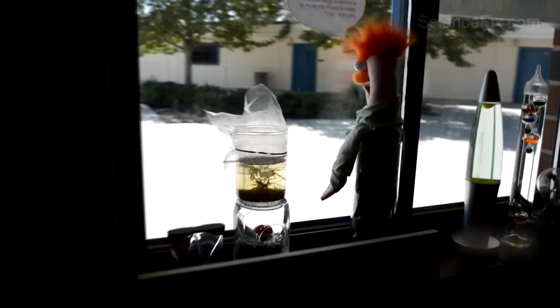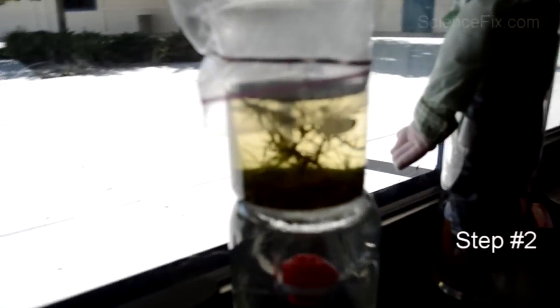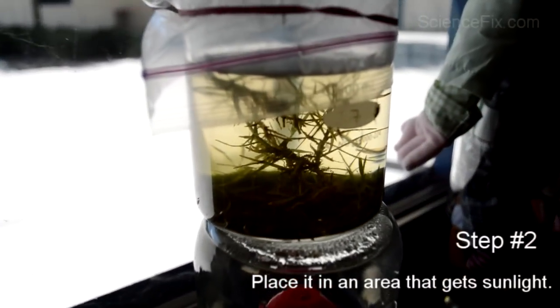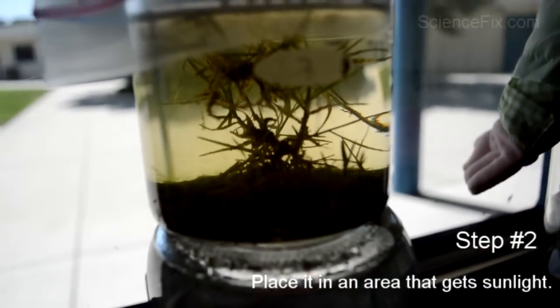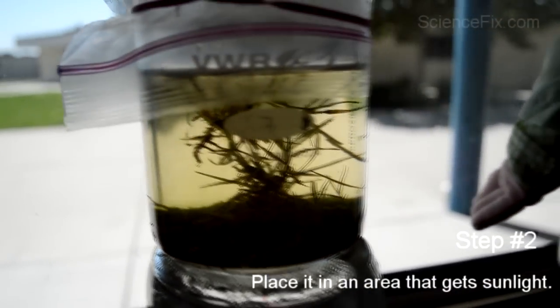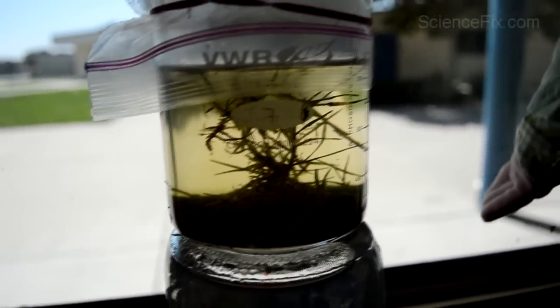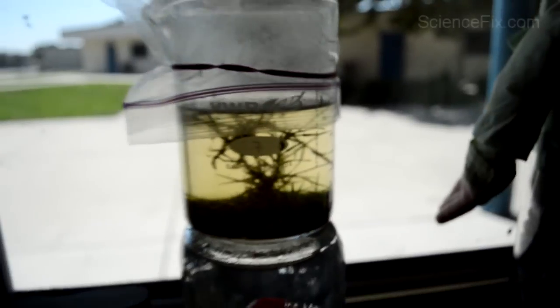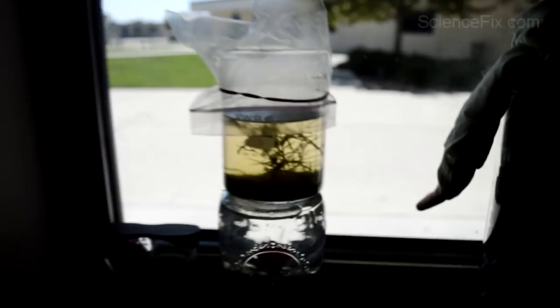You're going to want to put some kind of plastic bag that covers the beaker so that all the water doesn't evaporate out of it. Then put the beaker in a windowsill so it gets plenty of light, so that the plant life and algae can grow, and the other microorganisms can also flourish in that ecosystem.